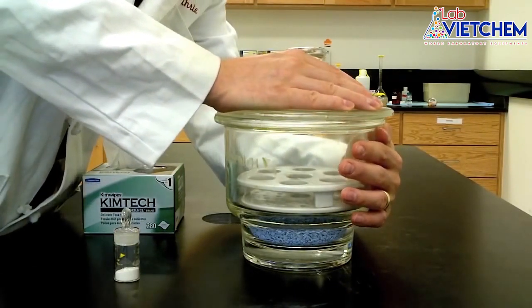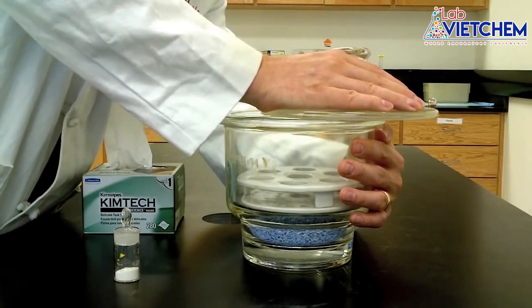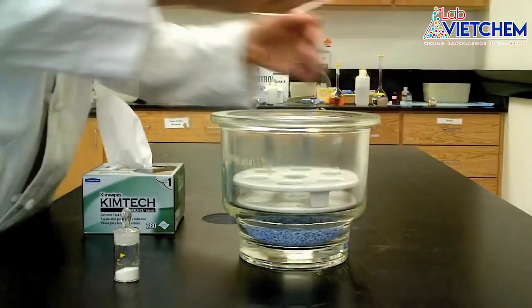What you've got to do is grip or even hug the desiccator with your arm and use the other to carefully slip off the lid. Take it easy.